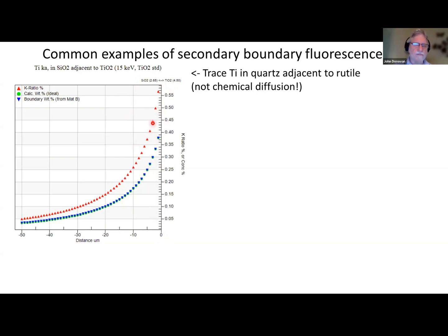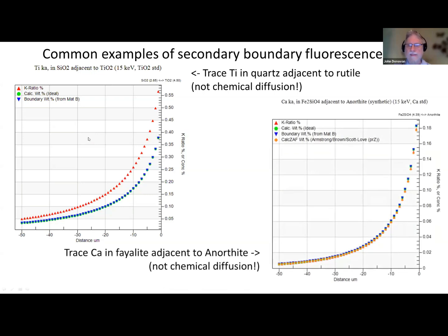I think we're using TiO2 as our primary standard, and then these are the concentrations. The green is the calculation of what we actually would see. Then the blue diamond is only the contribution from the boundary material. The reason they're the same here is because there's no titanium in the quartz example. And you can get other kinds of things. Here's an example of measuring calcium in an olivine adjacent to anorthite, which is a calcium-bearing mineral.